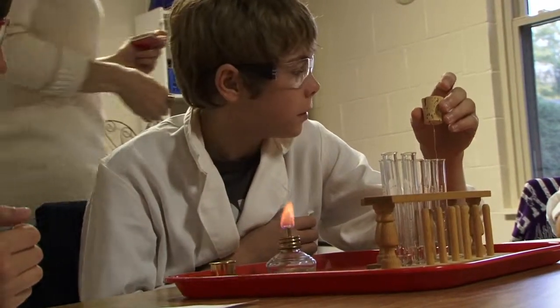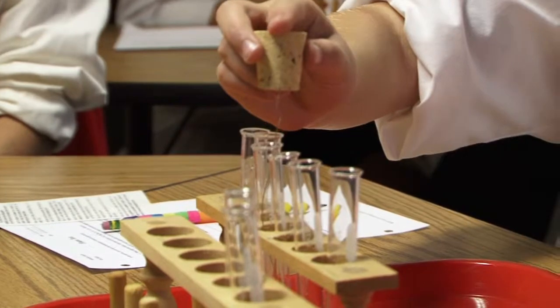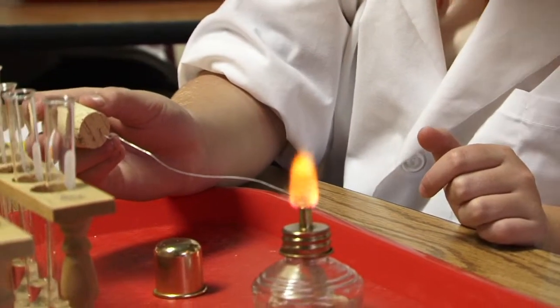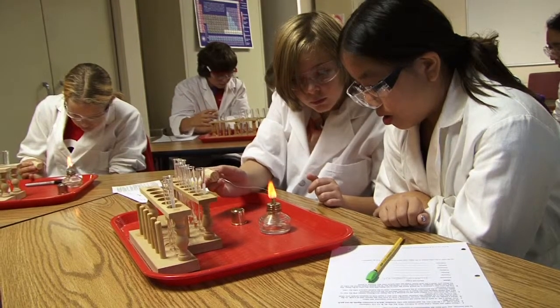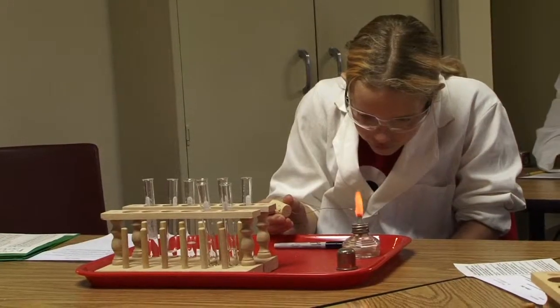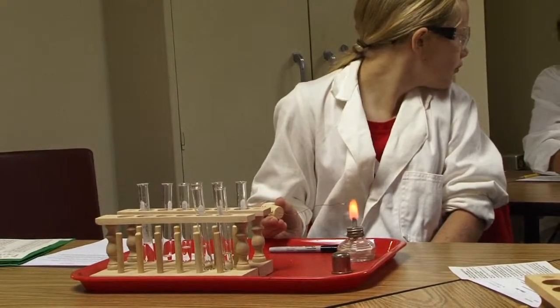Look, it's red! Is that the hydrochloric acid? Put it in the hydrochloric acid. I think I saw it. If you didn't see it, go ahead and do it again. Whoa! That was red.